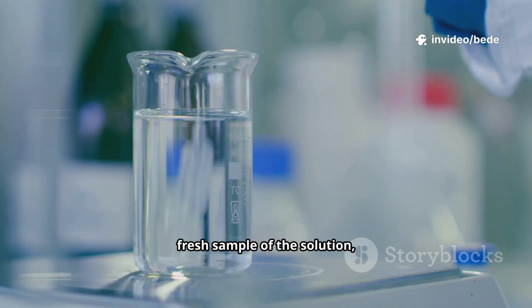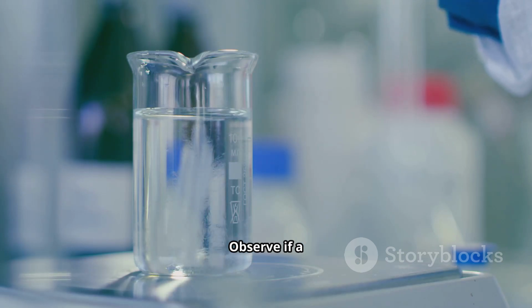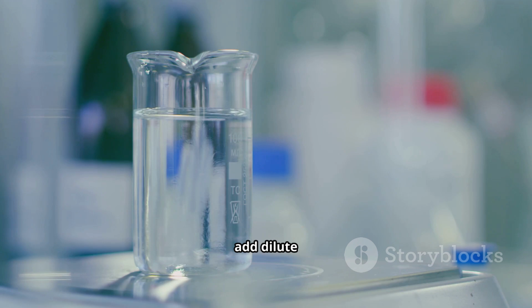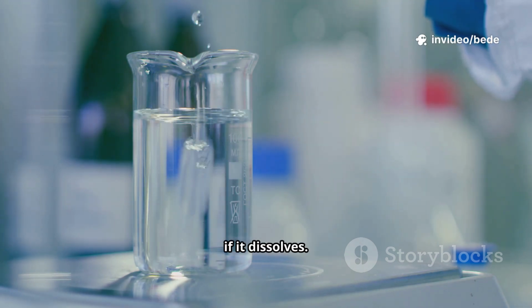Procedure: to a fresh sample of the solution, add barium chloride solution, BaCl2. Observe if a precipitate forms. Then add dilute hydrochloric acid, HCl, to the precipitate and note if it dissolves.